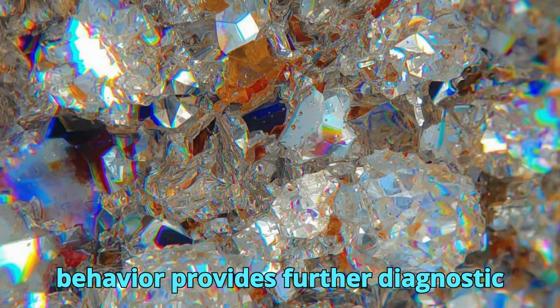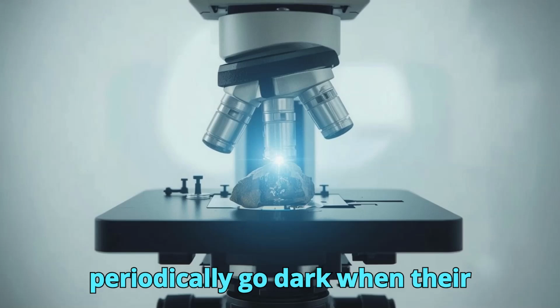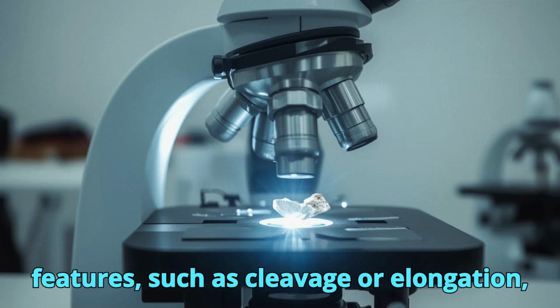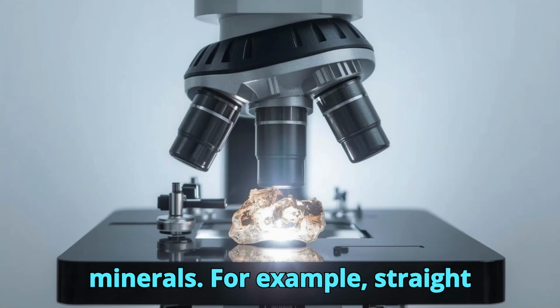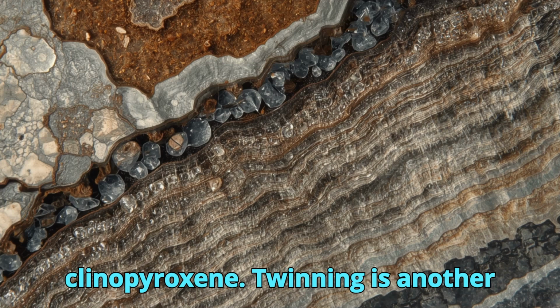Extinction behavior provides further diagnostic information. As the microscope stage is rotated under XPL, anisotropic minerals periodically go dark when their crystallographic directions align with the polarization directions. The angle between extinction and visible crystal features, such as cleavage or elongation, can be characteristic of specific minerals. For example, straight extinction is common in orthopyroxene, while inclined extinction is typical of clinopyroxene.